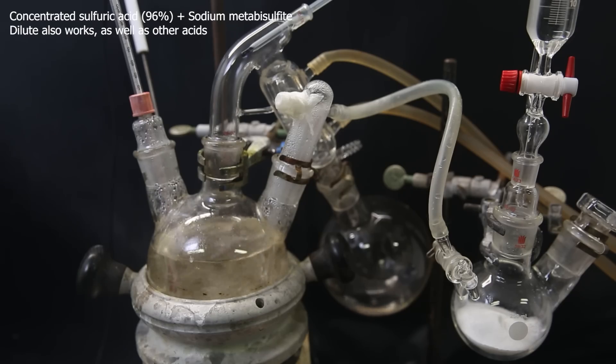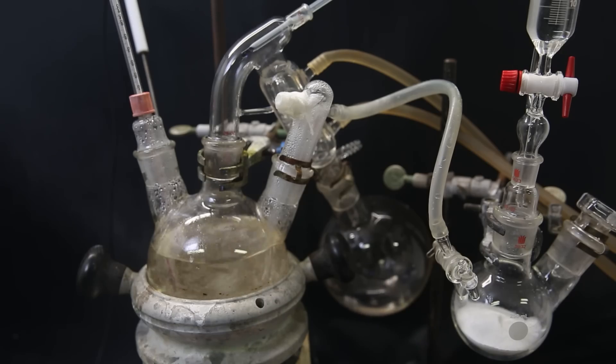Since it was late, I just left it to distill overnight and bubble sulfur dioxide until it stopped by itself, without adding more. The amount of sodium metabisulfite that I added was just random. In literature, they mention 1.5 liters of sulfur dioxide per hour, which is quite little.